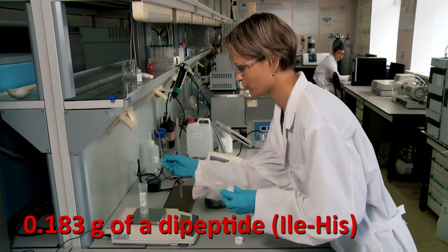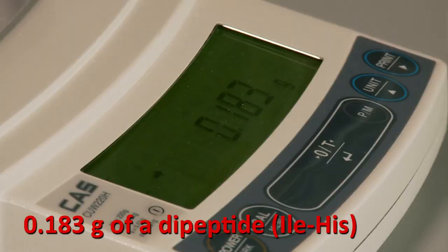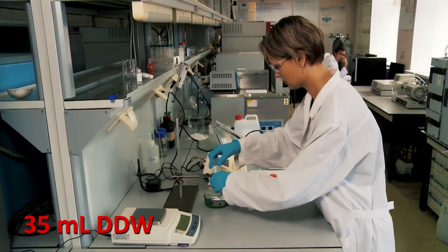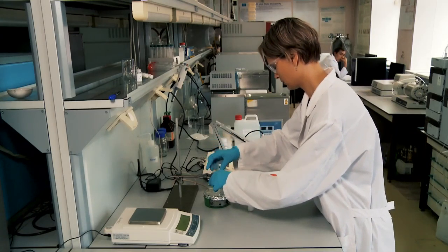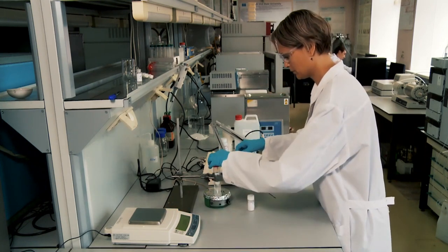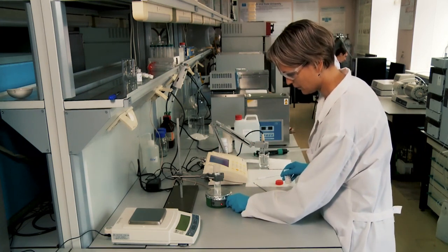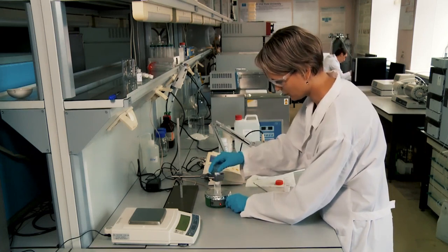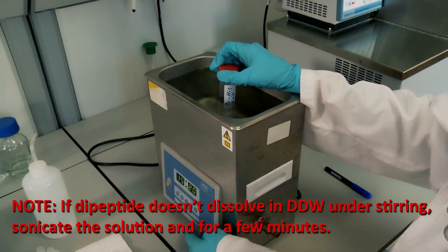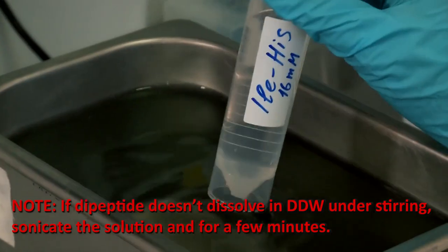Place 183 mg of dipeptide into a sterile polymeric test tube and dilute up to approximately 35 ml with double distilled water. Dissolve at room temperature under vigorous stirring. If the dipeptide doesn't dissolve, place the solution into an ultrasonic bath and sonicate for a few minutes.